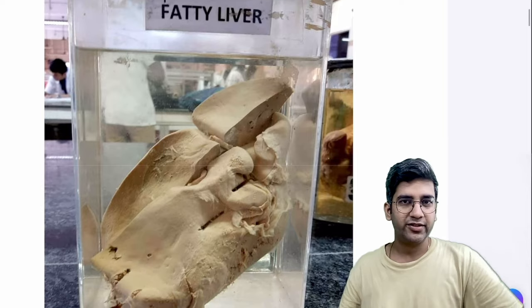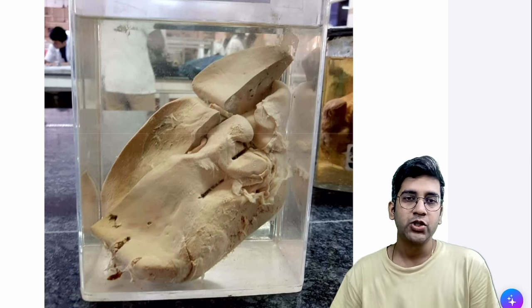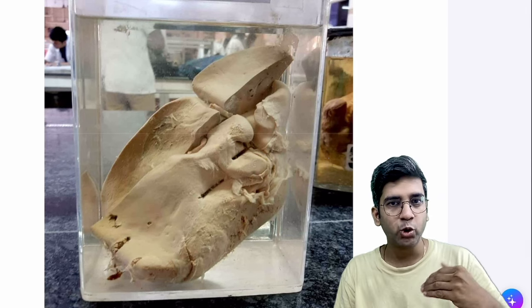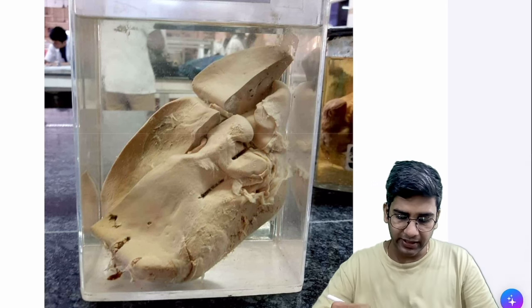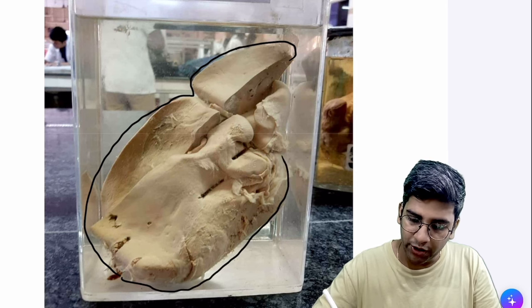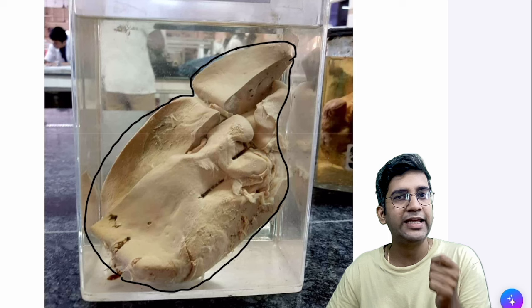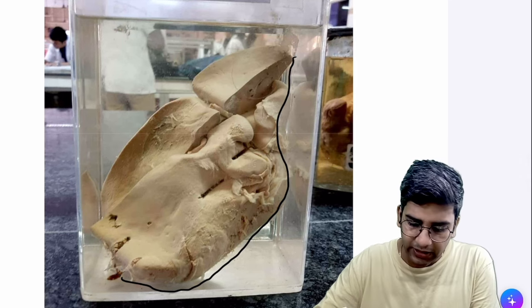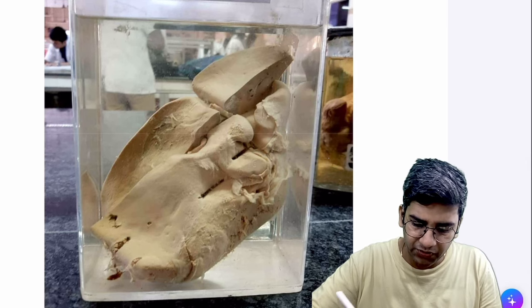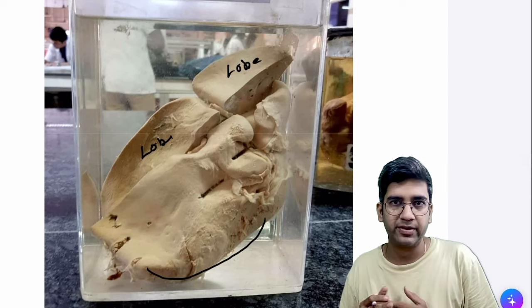Now, looking at this, it's a clear case of fatty liver and you may already know the diagnosis. The bigger challenge is how to describe it properly. When describing any specimen, I start with: this is a jar-mounted specimen of most probably an entire liver. By looking at it, I can see the entire architecture of the liver — the lobes — and everything is present. I can identify it as a liver based on the lobes visible here and the very smooth outer surface, as well as the shape.